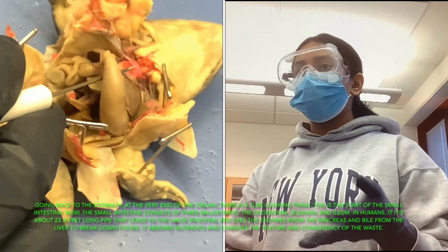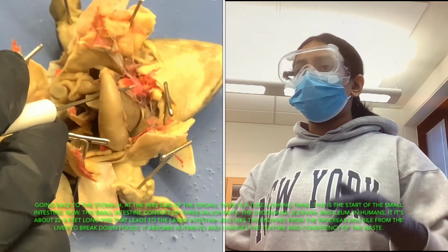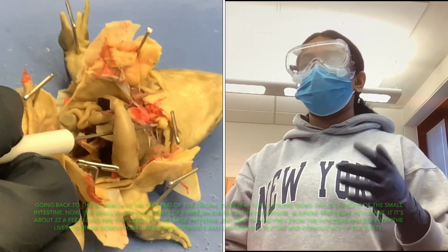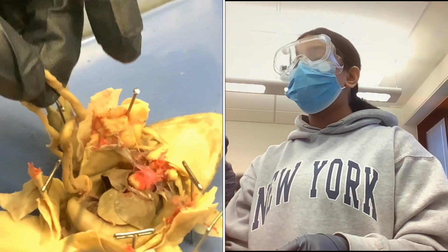In humans, it is about a 22-foot-long pipe that leads to the large intestine, and it uses the enzymes from the pancreas and bile from the liver to break down foods. It also absorbs nutrients and changes the texture and consistency of the waste. This leads to the large intestine, which will be the last exhibit for today.